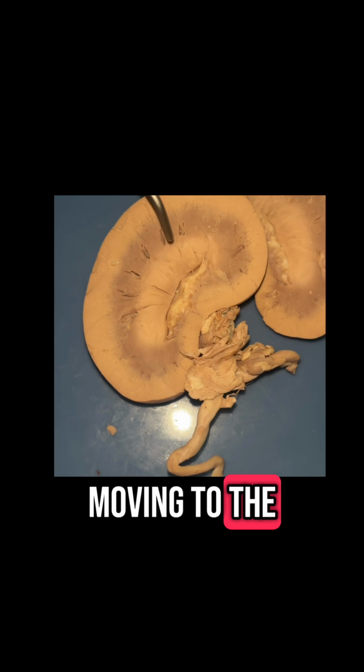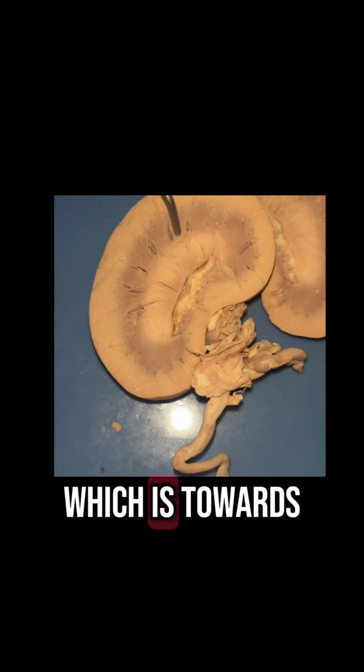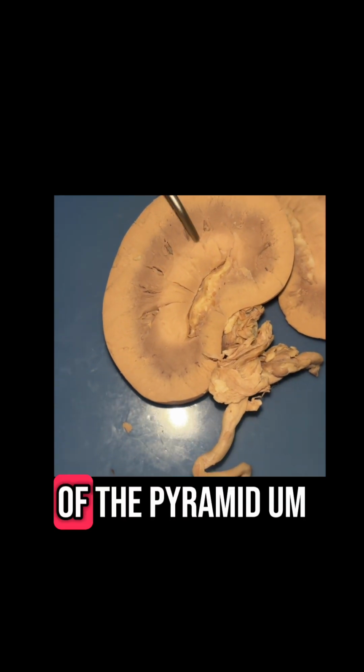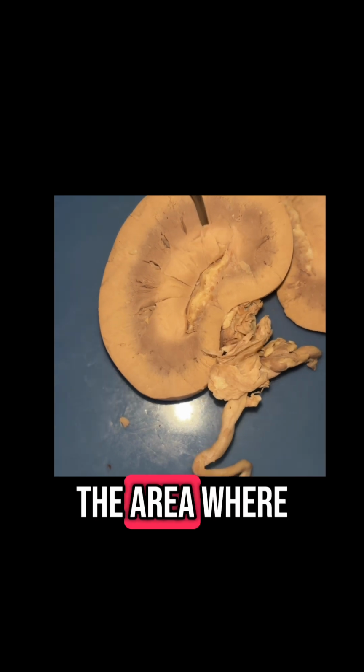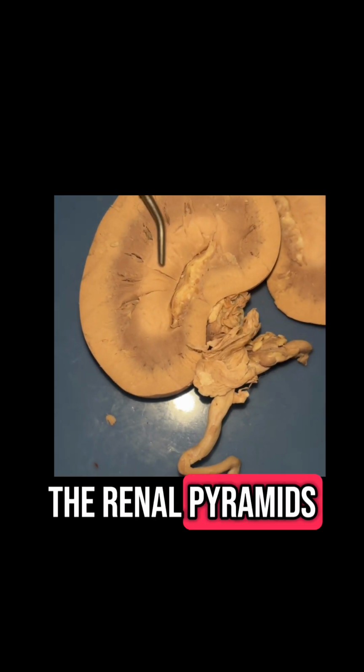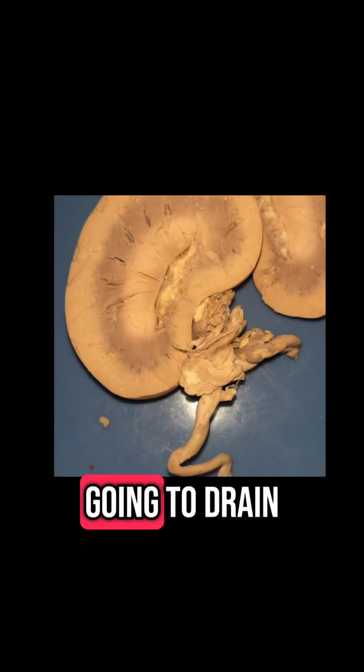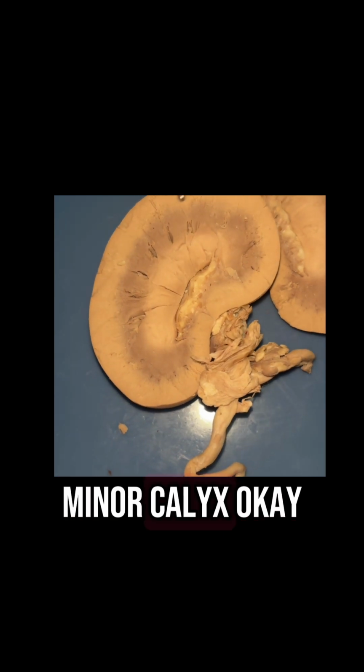Okay, and then moving to the renal papilla, that's going to be the pointed tip, which is towards the renal pelvis. The base is going to be towards the renal cortex, which is out here. So the tip of the pyramid, this is the area where the urine exits the renal pyramids after it's been concentrated and processed, and then it's going to drain into the minor calyx.